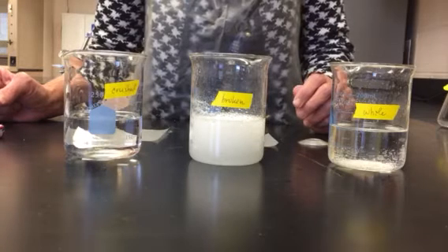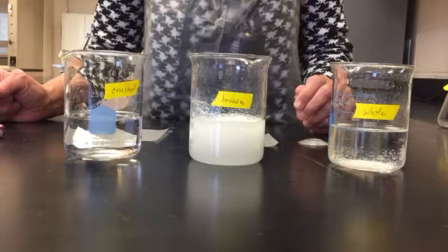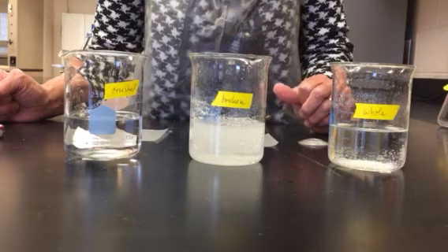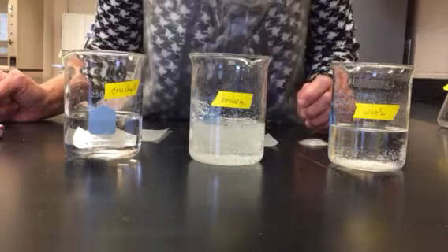Again, I'm being patient. Again, it's not finished yet. There are still bubbles.